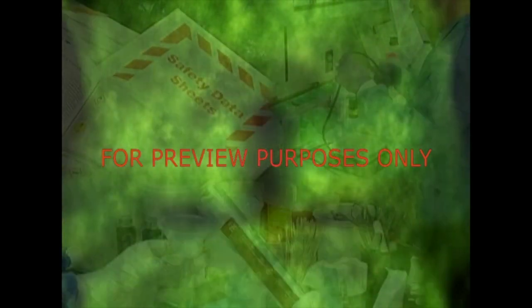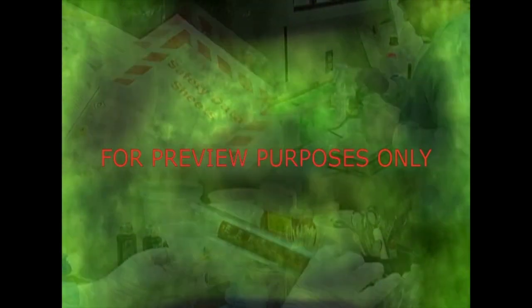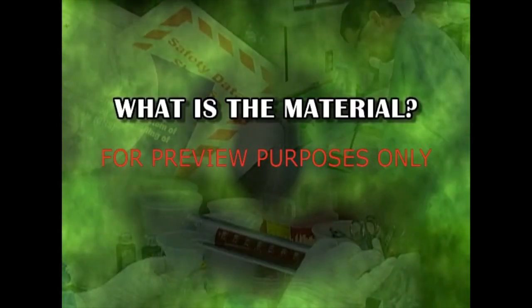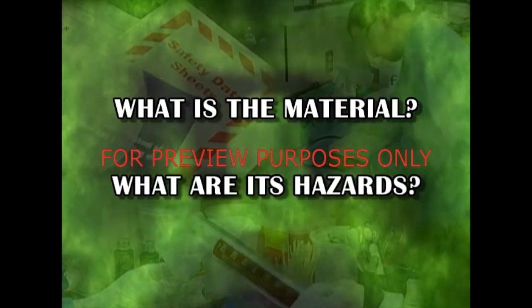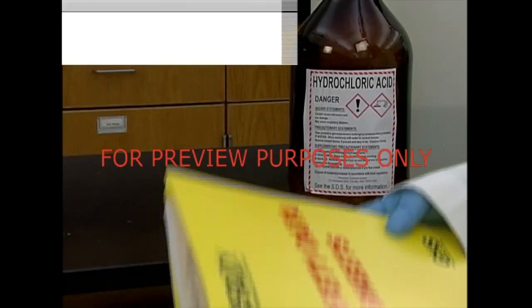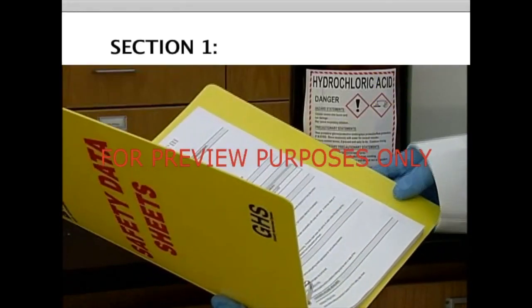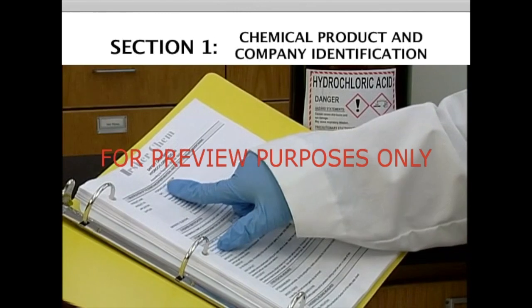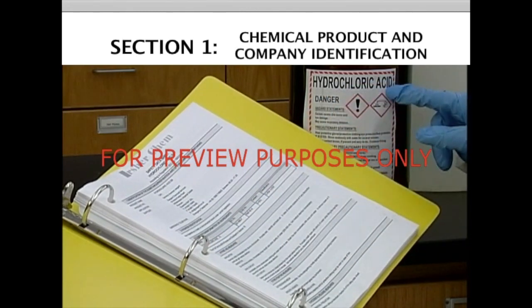Each of these questions is answered by one or more sections of the Safety Data Sheet. For example, Sections 1, 2, and 3 provide answers to the first question: what is the material and what are its hazards? Section 1 of the SDS identifies the material using the standard GHS product identifier.